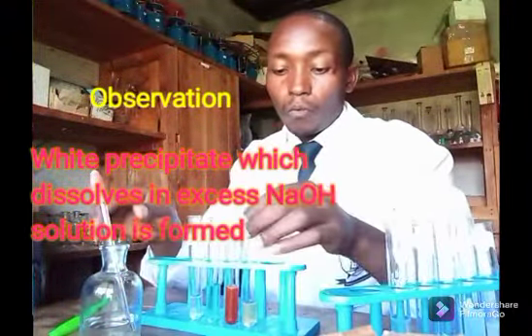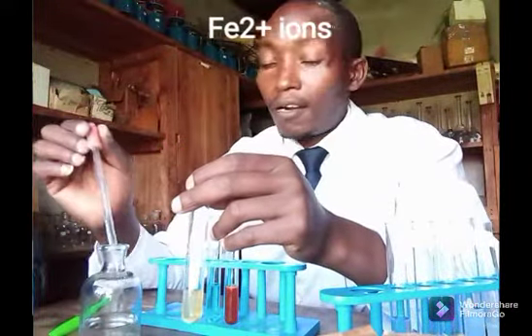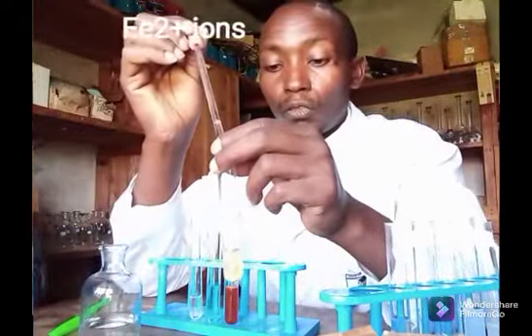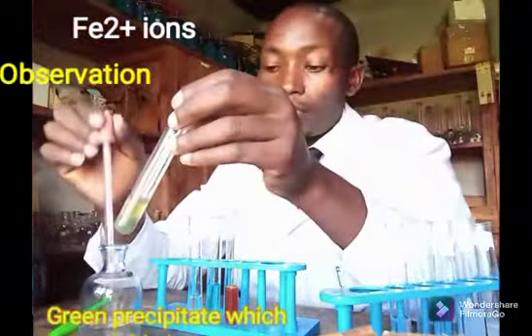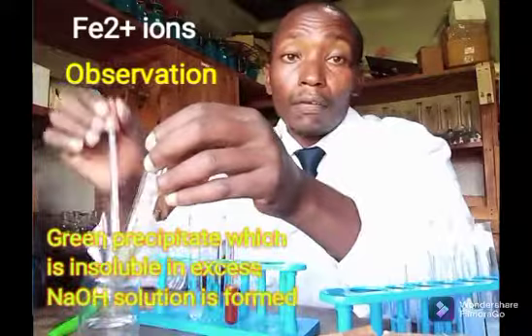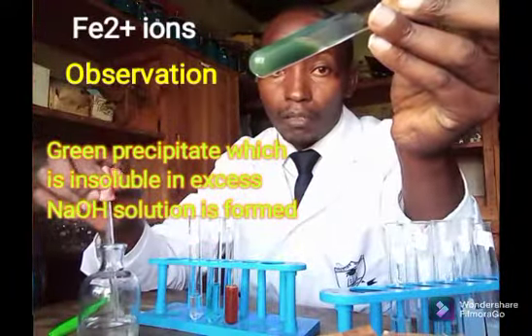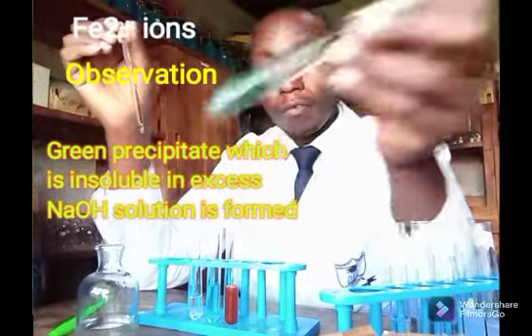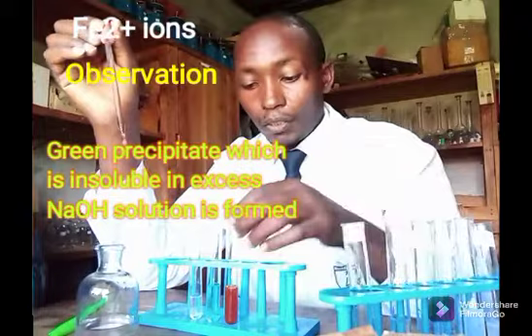We go on with another solution containing iron 2. With iron 2, the very same thing. Green, we observed before with aqueous ammonia. So the green precipitate there, that is very much insoluble. That is a green precipitate.